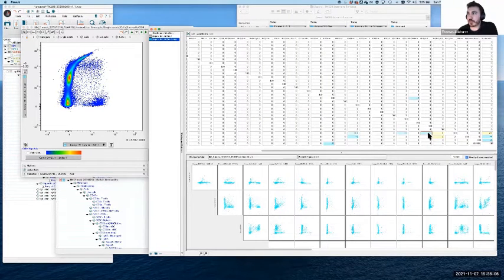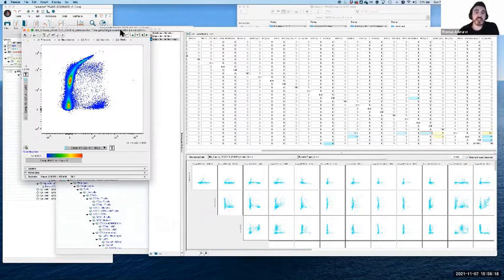It's really a bit weird because we're starting at 0 and going positive to move it to the left or negative to move it to the right. It's very weird to think of it that way, but it actually works the same way as a normal compensation matrix would. And much the same as the normal matrix, we can do that using the sample alongside the FMOs to make those assessments very carefully, so we're not just arbitrarily moving populations around.